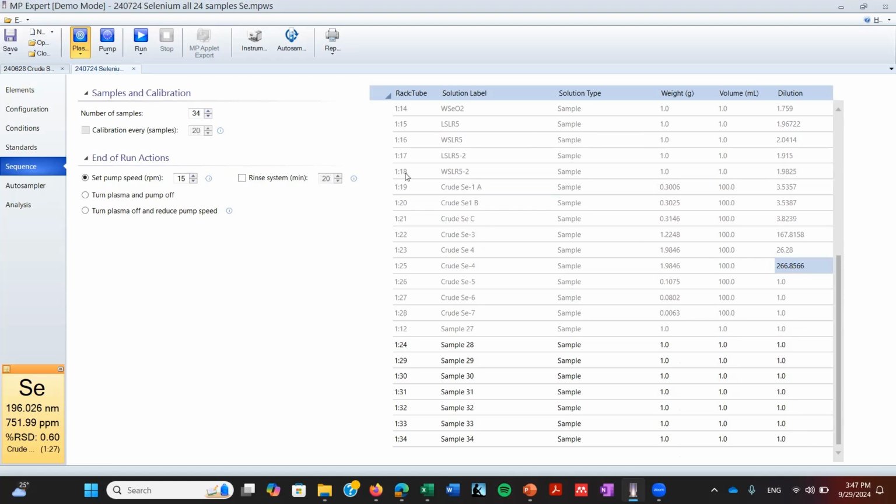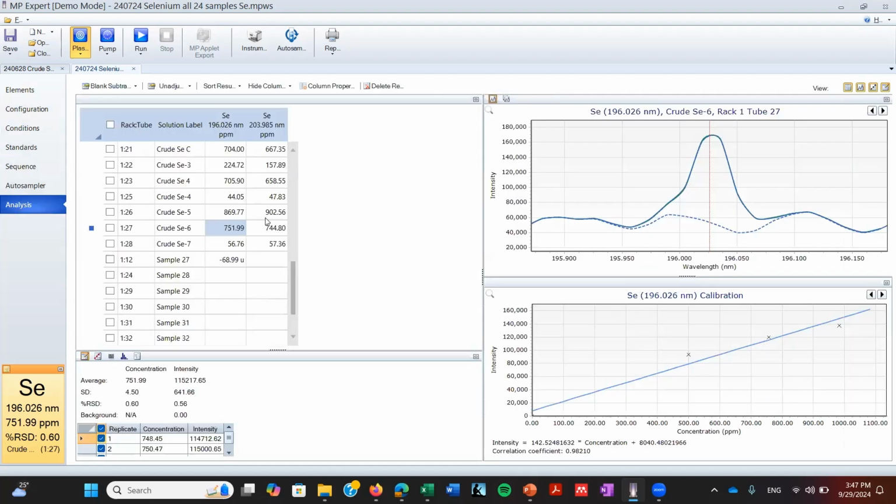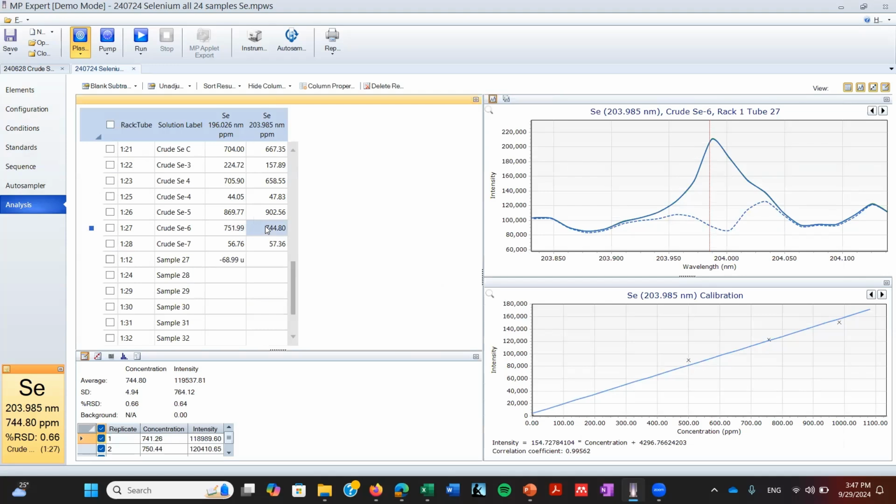So that's the difference between the unadjusted concentration and the corrected concentration: the unadjusted doesn't consider these correction factors. They are both very useful, because the unadjusted concentration lets you know if you are between the standards. The actual concentration gives you the value of that concentration that you before said was valid.